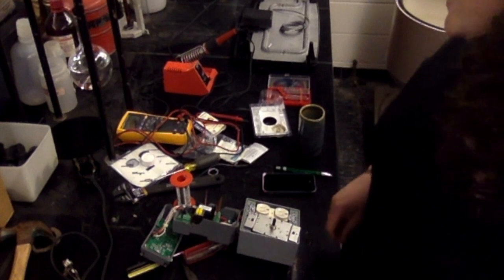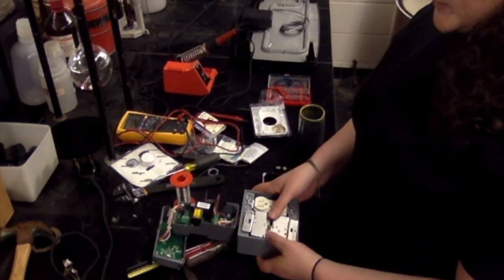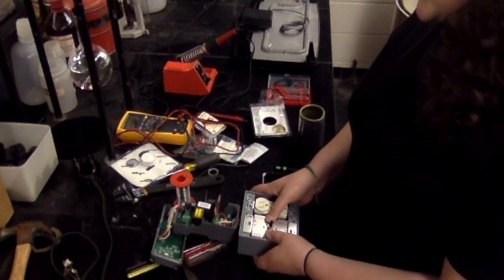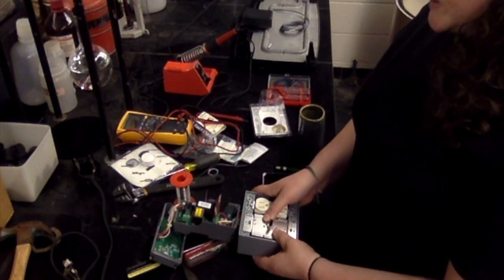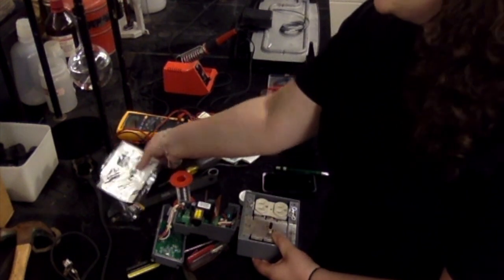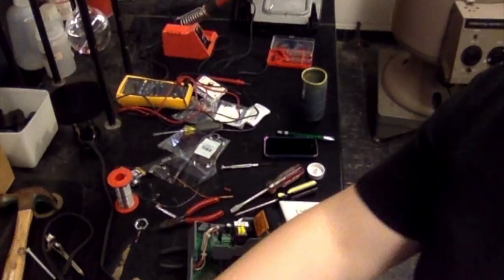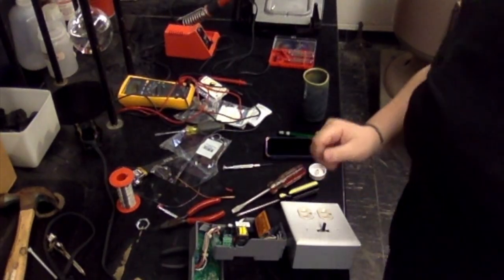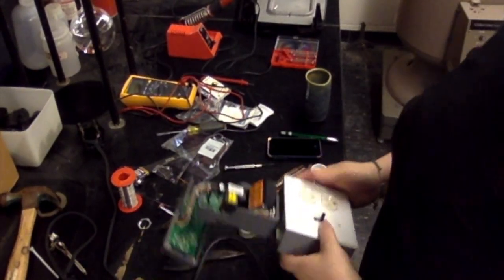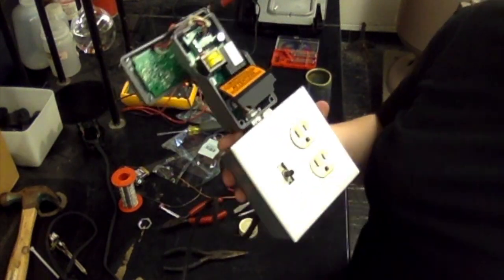So I would just make sure that everything is connected, maybe go over the connections again to make sure you have everything correctly oriented, and then you're just going to mount everything. So you'll take some screws and get this mounted here, and then we have a plate here that we will also fasten to the top. Okay, so all the bottom part has been done, and I've gone ahead and placed the plate on the outside of the box.